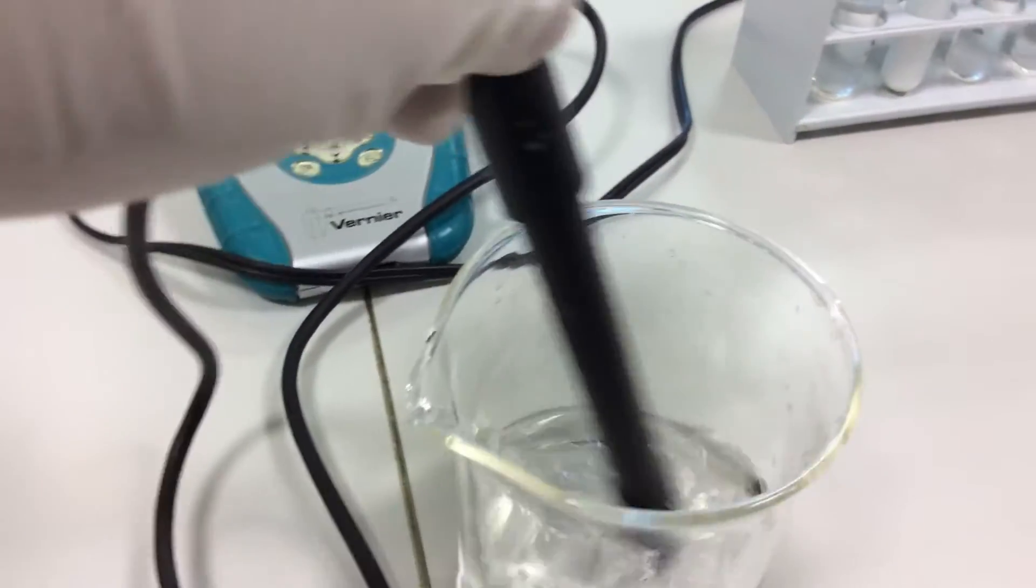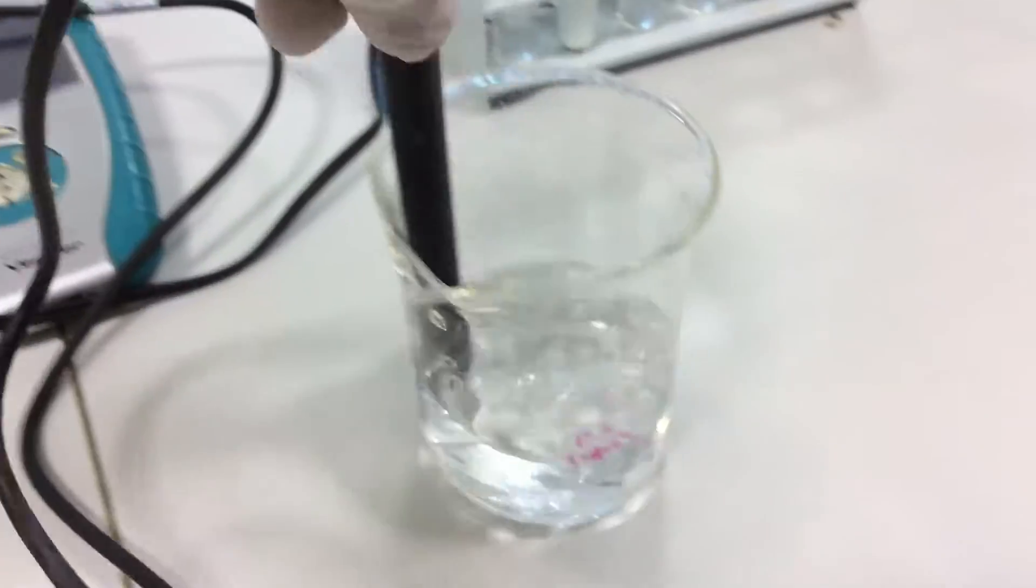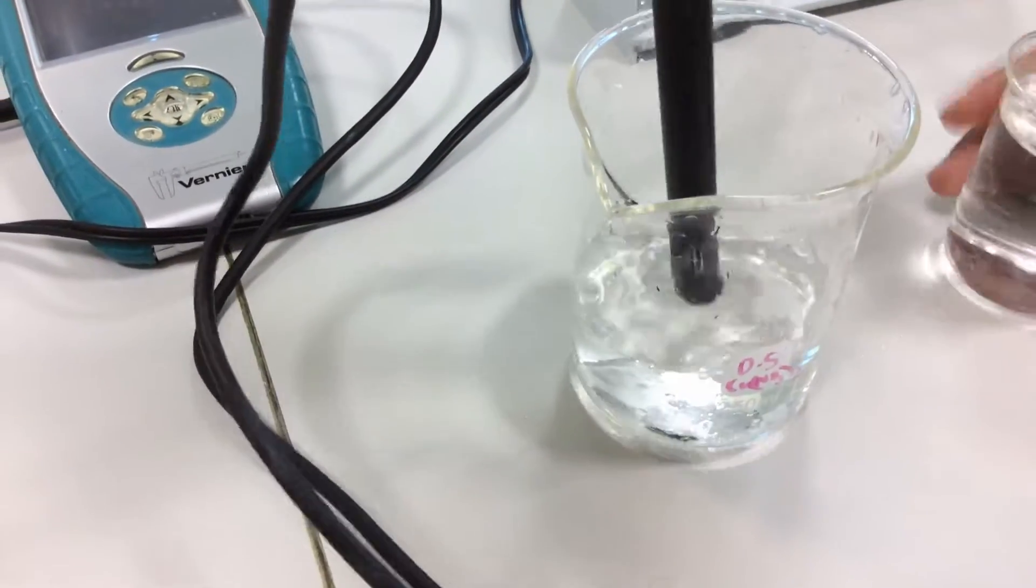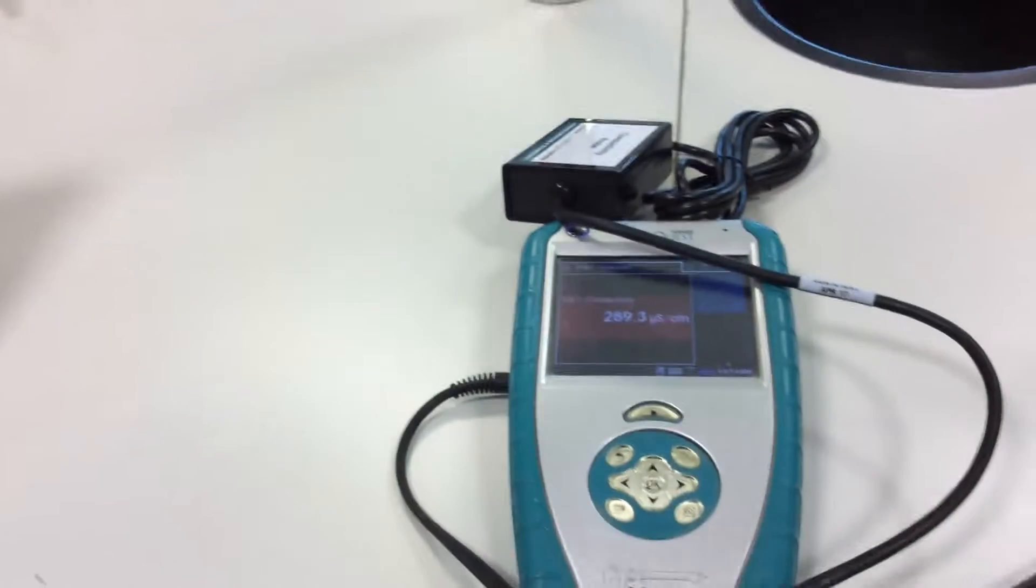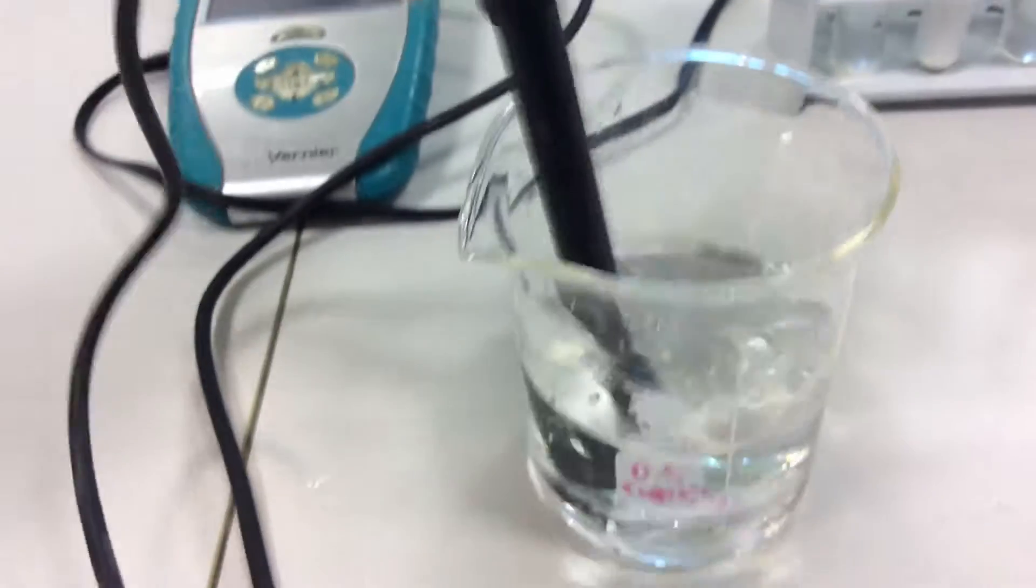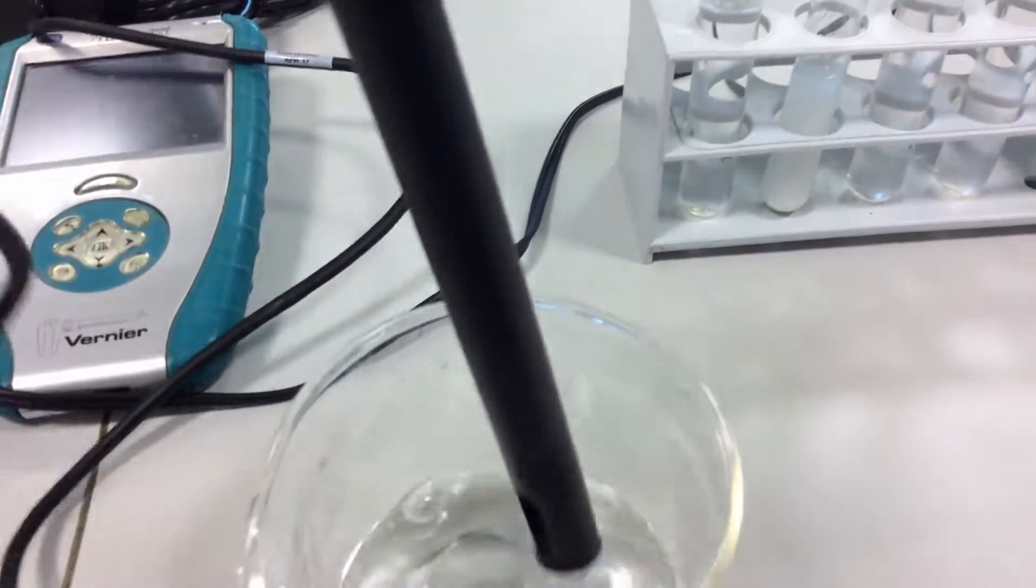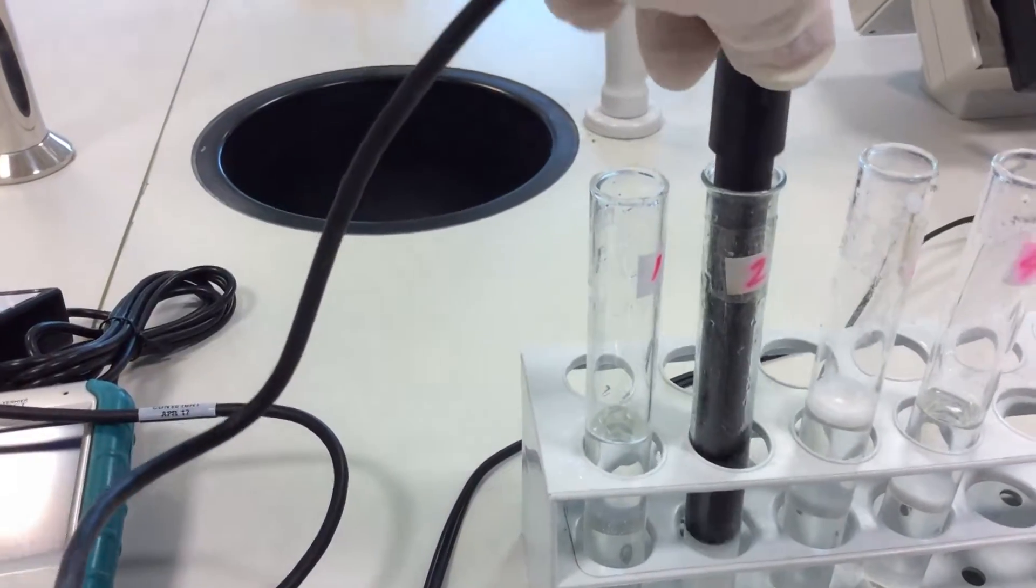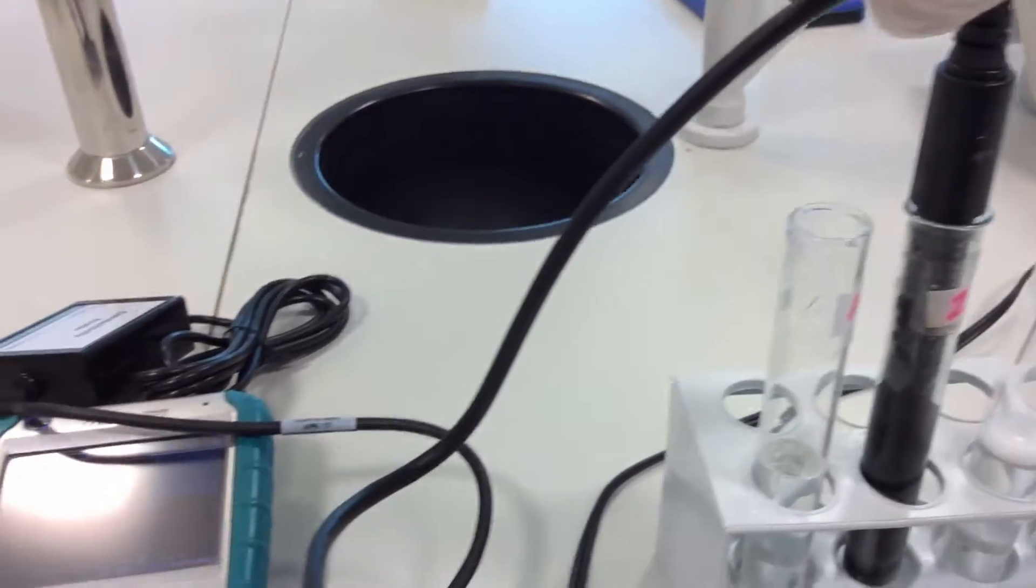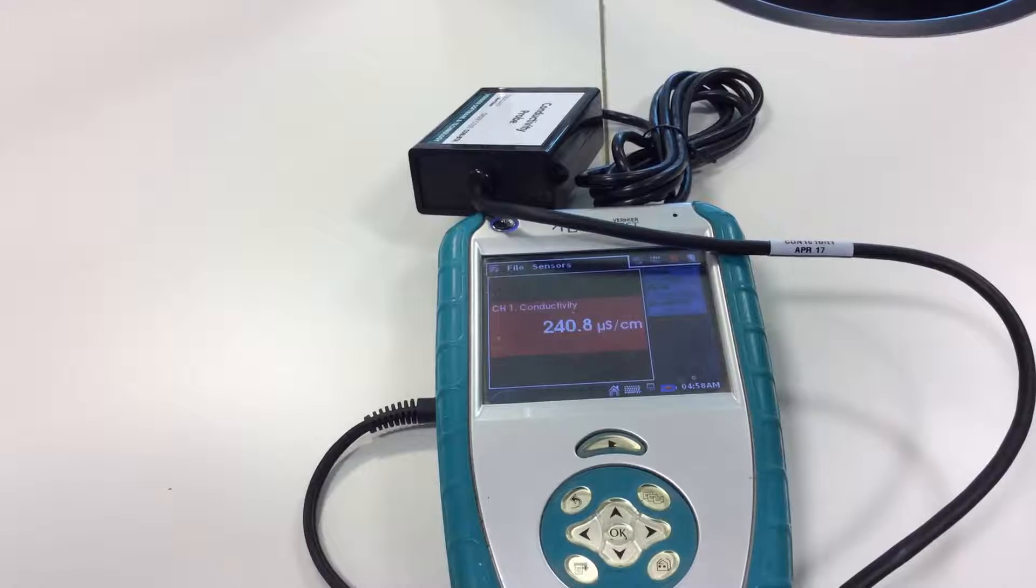I am washing this now. Wash it very carefully. Now let's test the conductivity of starch. It is immersed inside and here you can read the conductivity value.